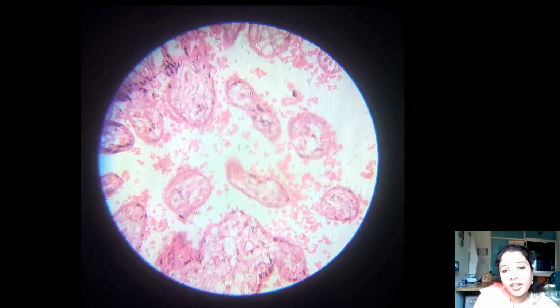So this is at a higher magnification where we can see each villus, and inside the villi we can see cut sections of blood vessels easily. The mesenchyme is here, and the cytotrophoblast is lining each one, surrounded by the syncytiotrophoblast, and we can see some blood cells also in the intervillous space, which is filled with maternal blood.